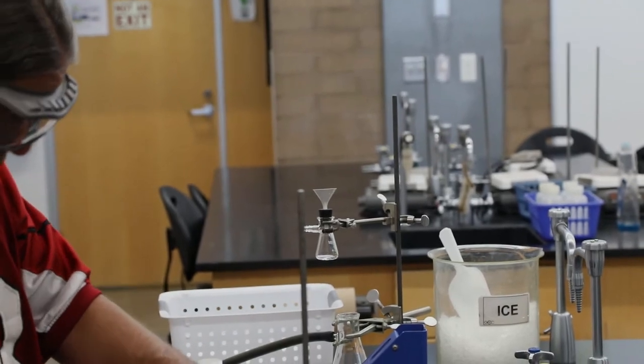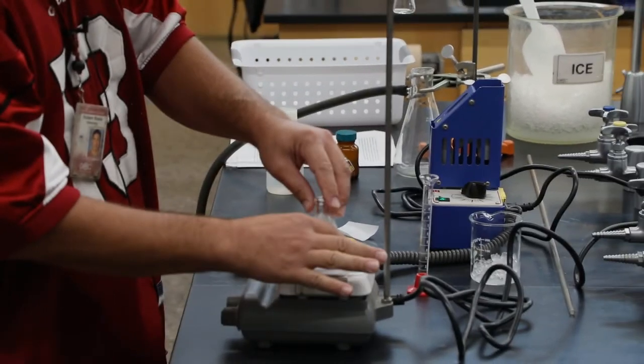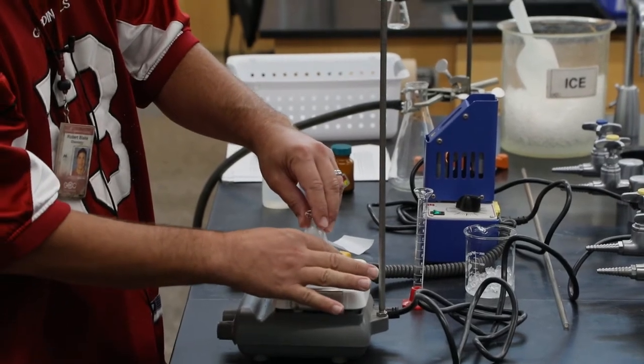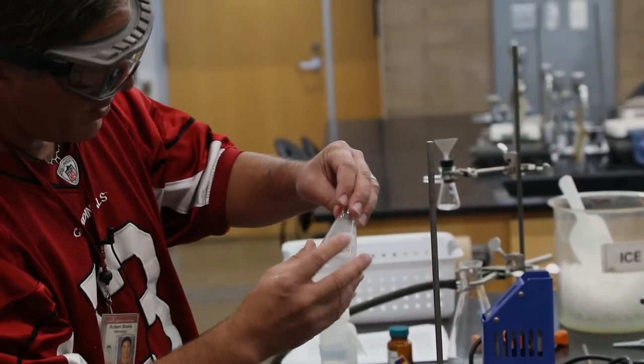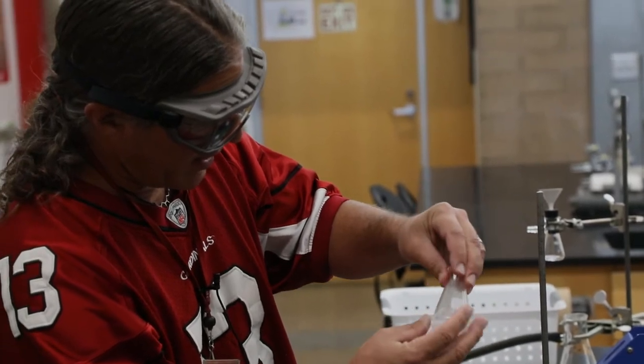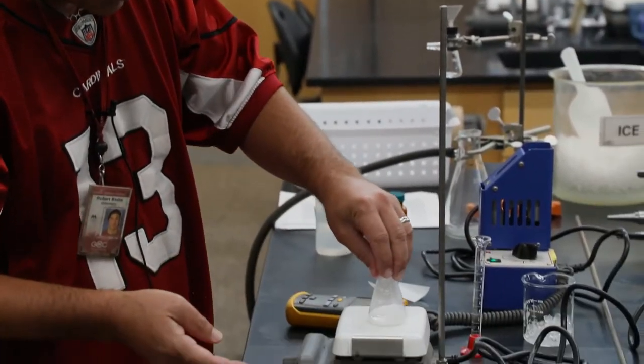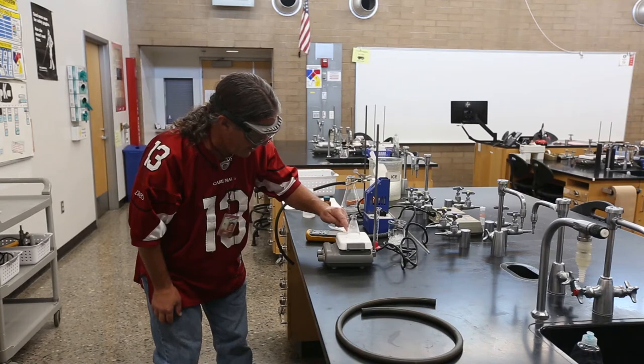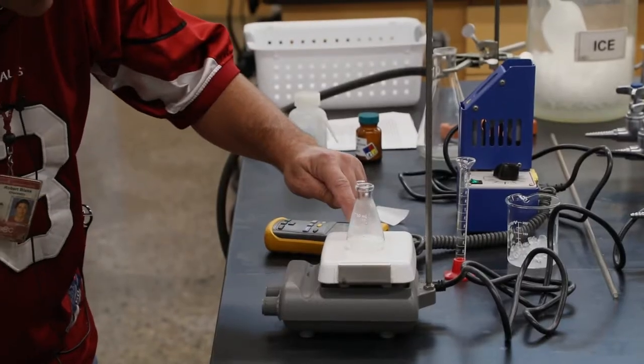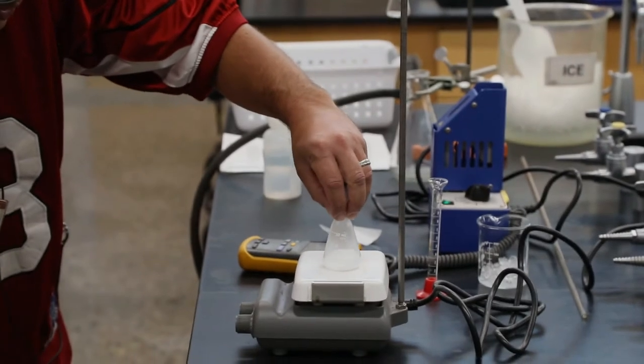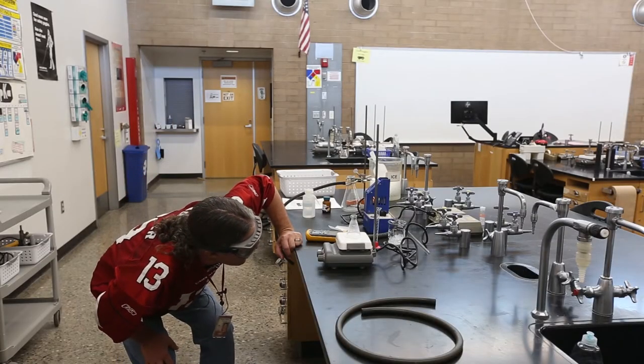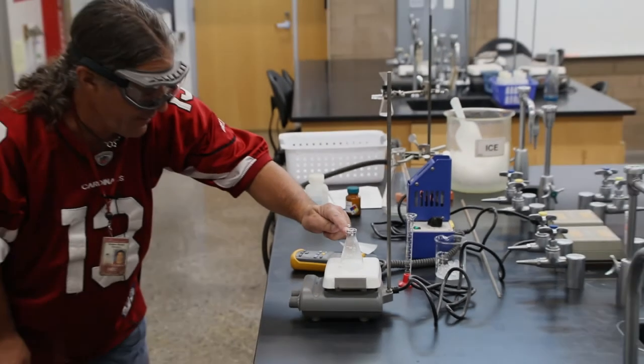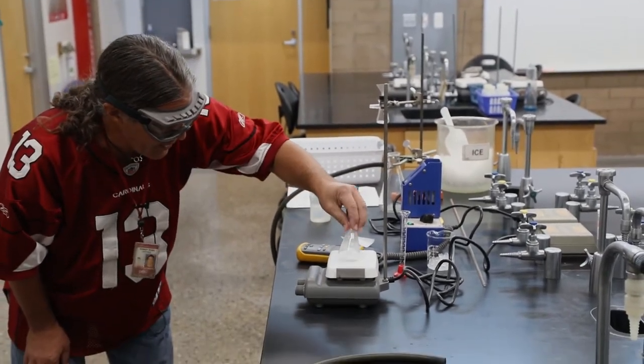Again, occasionally we want to check to see how this is warming up. We don't want to really boil it if we don't have to. We want to dissolve it hopefully just shy of boiling temperatures. And I'm going to swirl it around and make sure that if there's any solid on the sides of the flask, it manages to get down in the flask. It is warming up nicely. It's still sort of a nice bath temperature. It's not too hot to touch. Make sure you don't touch the ceramic. This might get really hot, like 120, 130 degrees Celsius. The top of the flask is generally going to be nice and touchable, even when the solution is pretty warm, even as long as you don't boil it. If you boil it, then this will get up to boiling water temperature. Then you don't want to touch the flask.